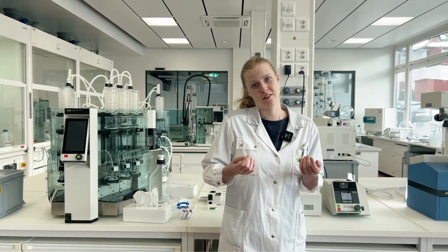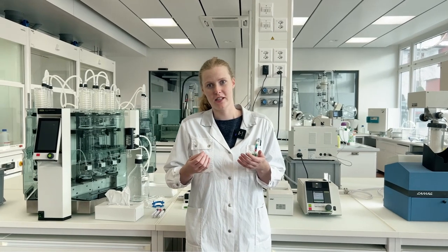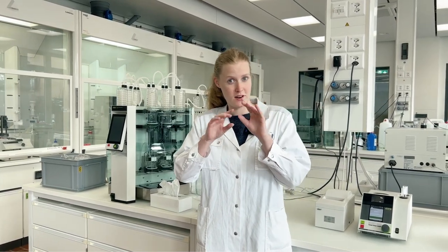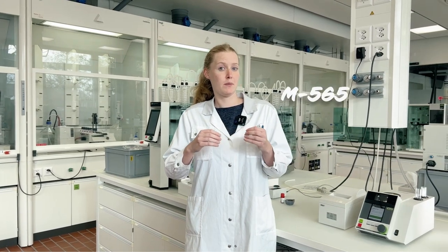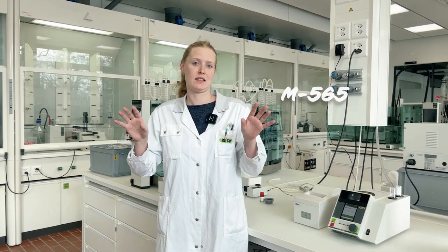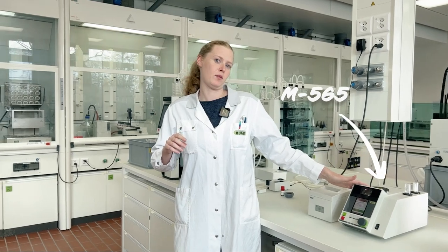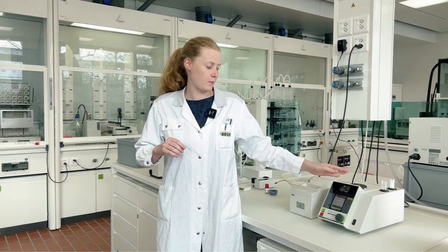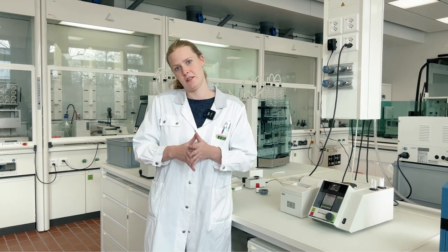There are two melting points that scientists have agreed on. One is the melting point according to pharmacopoeia and the other is the thermodynamic melting point. The thermodynamic melting point is where the particles first start to melt, and the pharmacopoeia melting point — also called the clear melting point — is when everything has melted. Our Büchi melting point device can measure both, but the pharmacopoeia melting point is more commonly used.